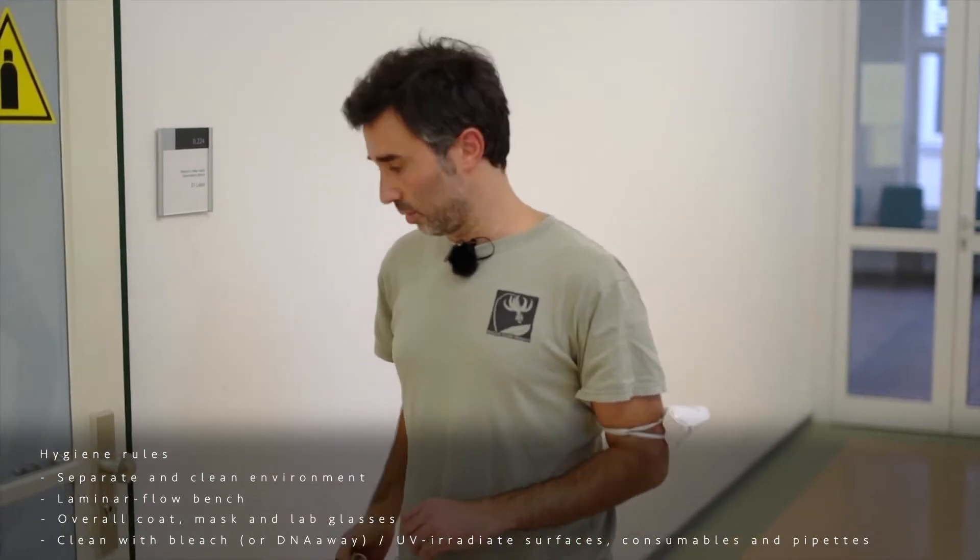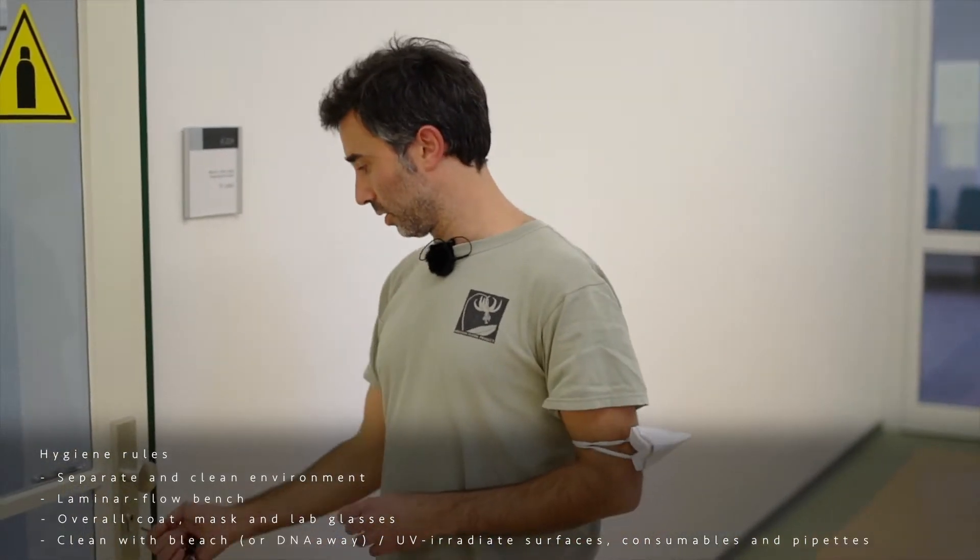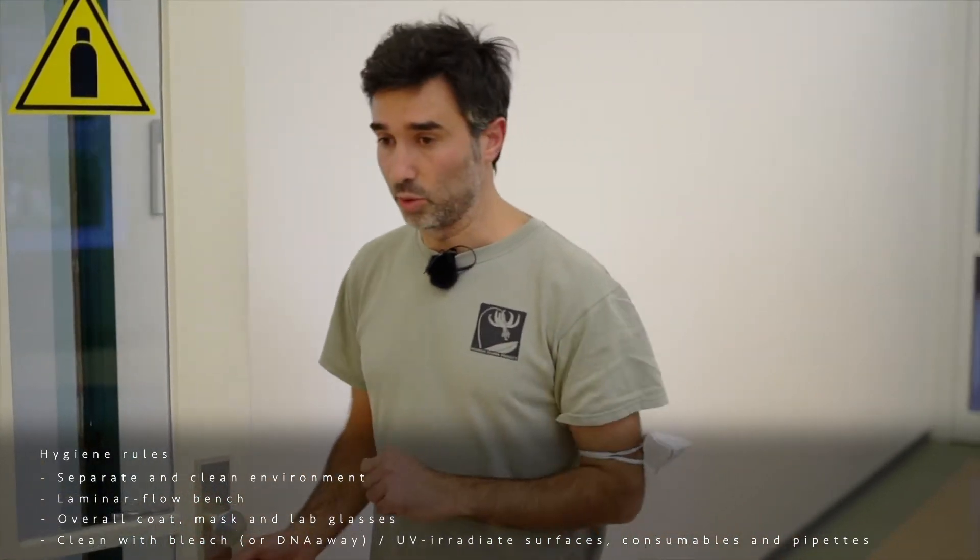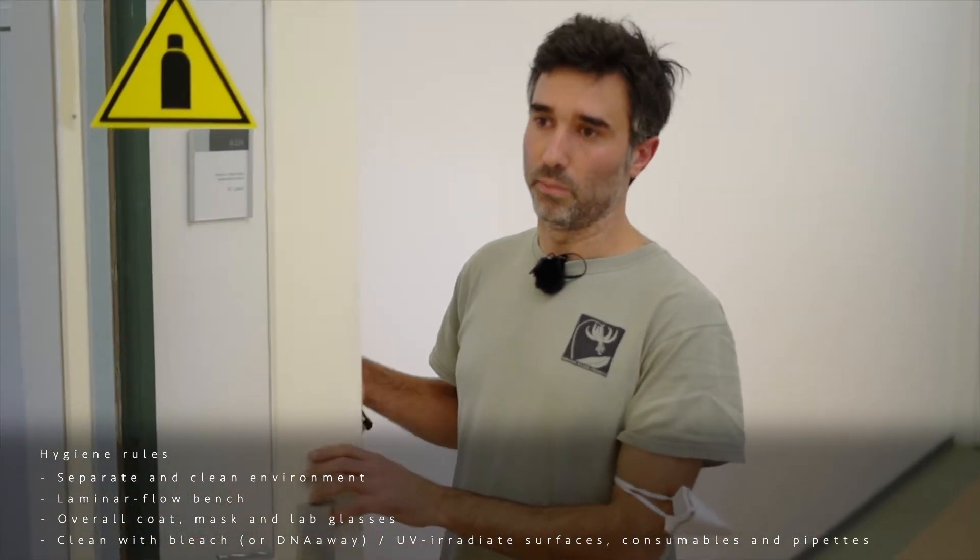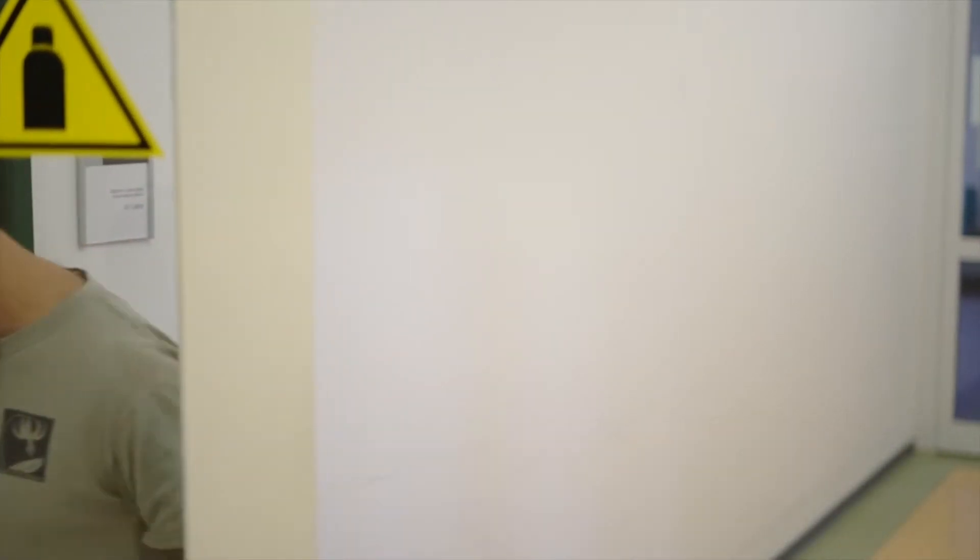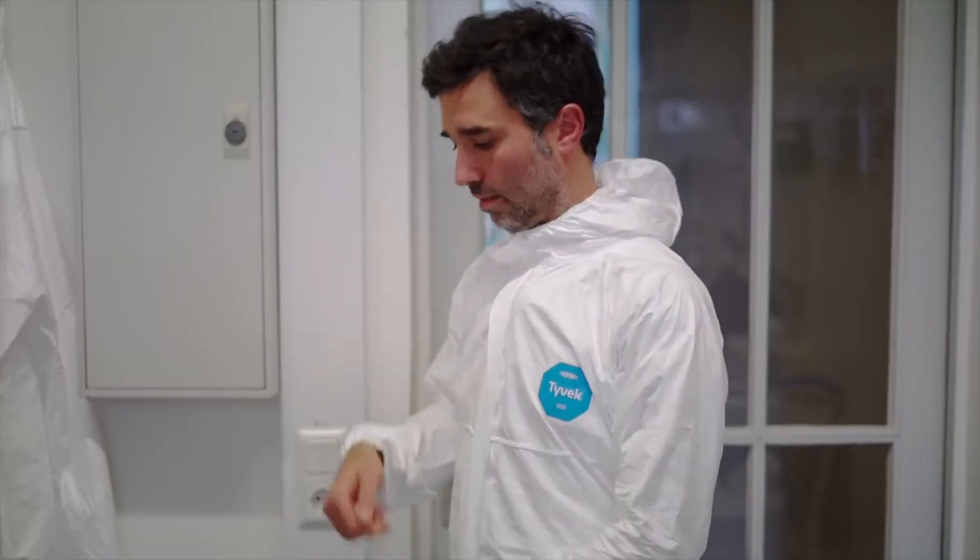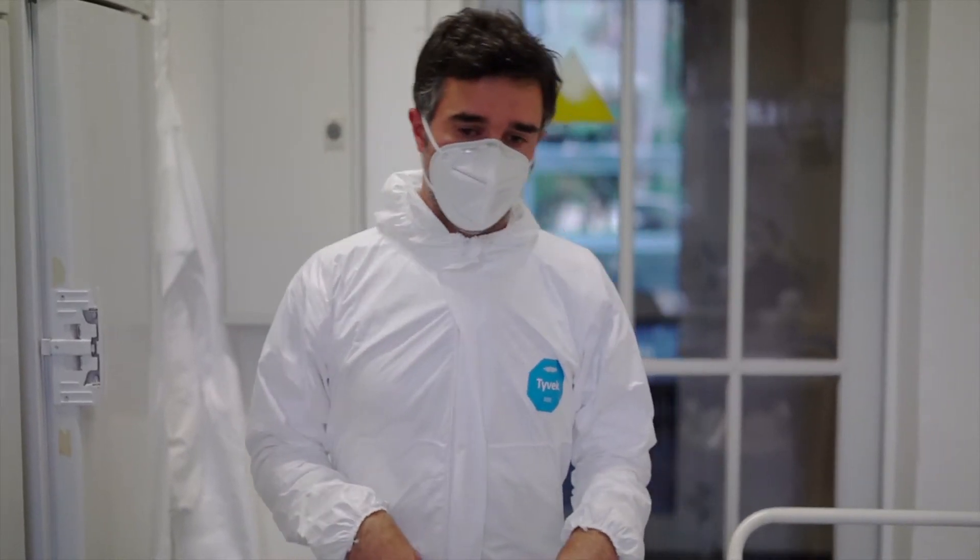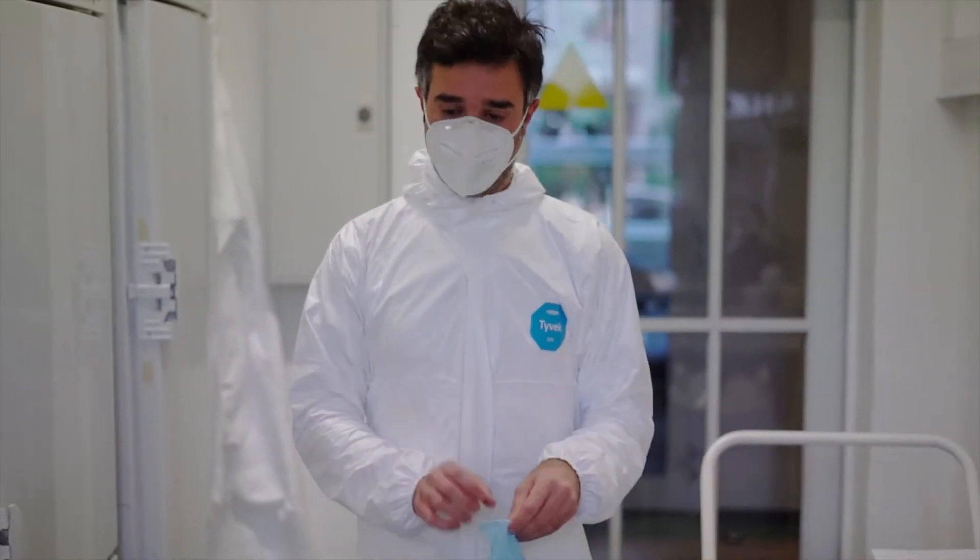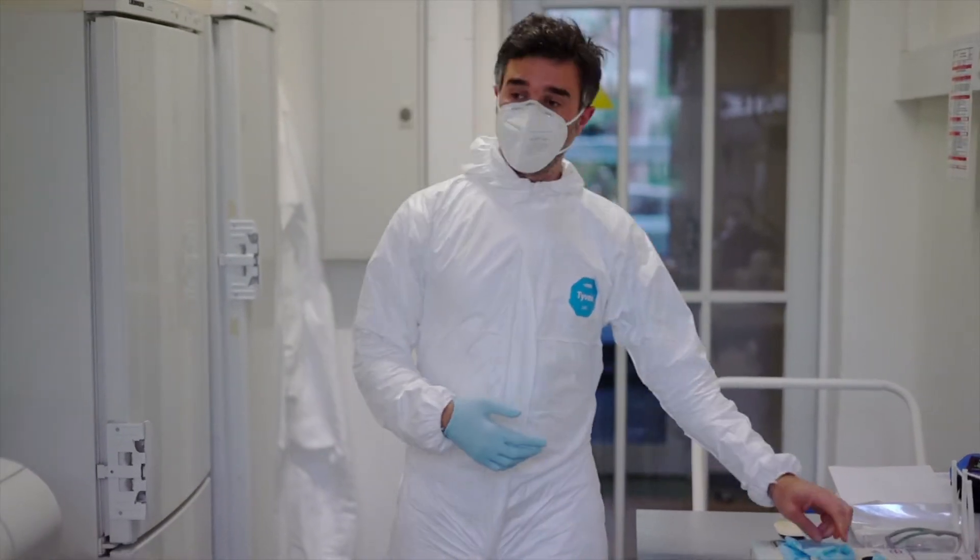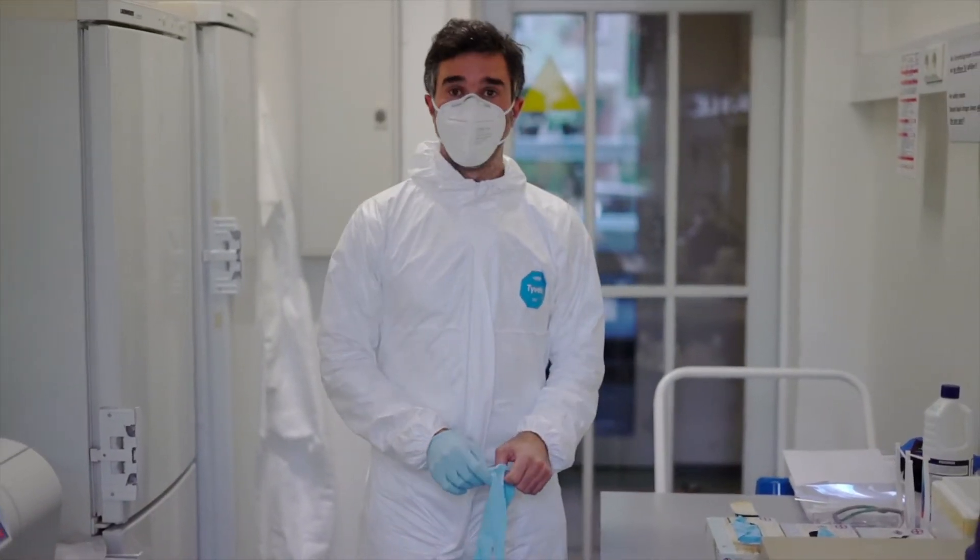For example, we have to dress a specific coat, an overall coat, and we also use masks. Everything in there will be cleaned with bleach or with a specific product like DNA away. Gloves of course, and everything here has to be cleaned with either bleach and DNA away or irradiated with UV light.